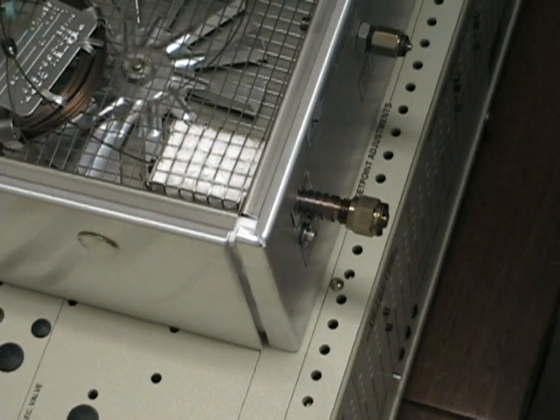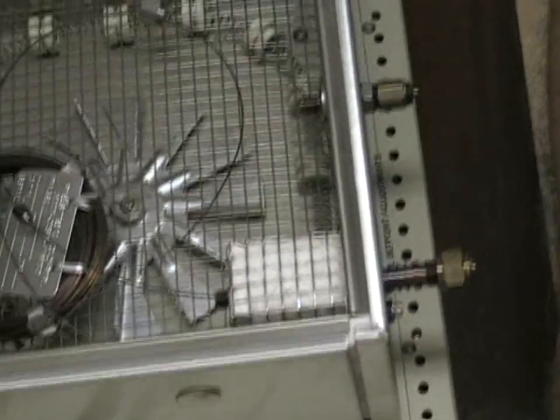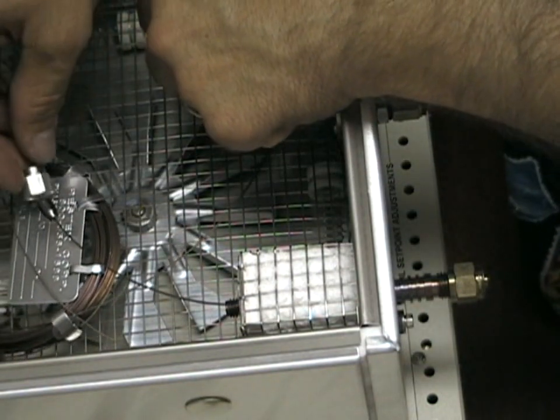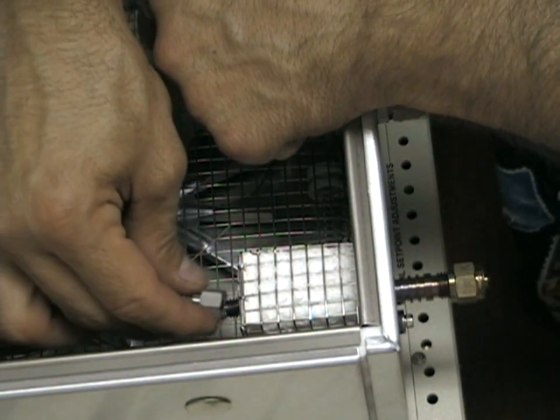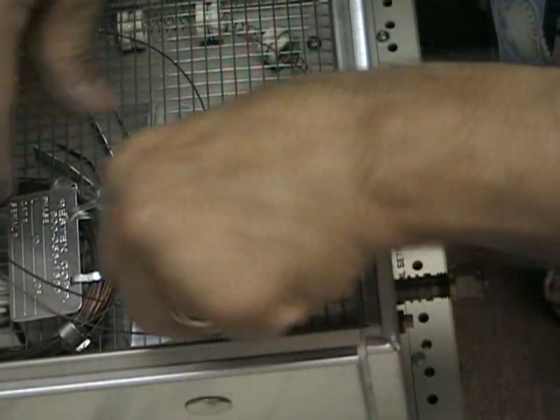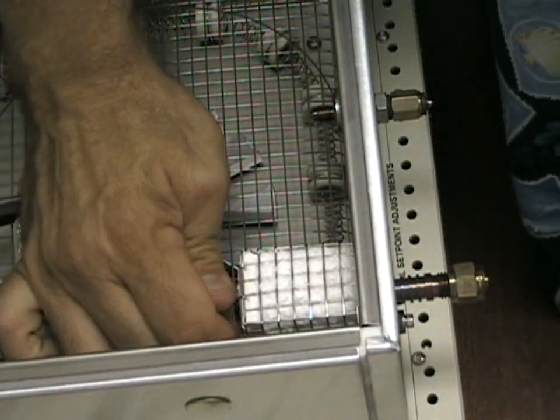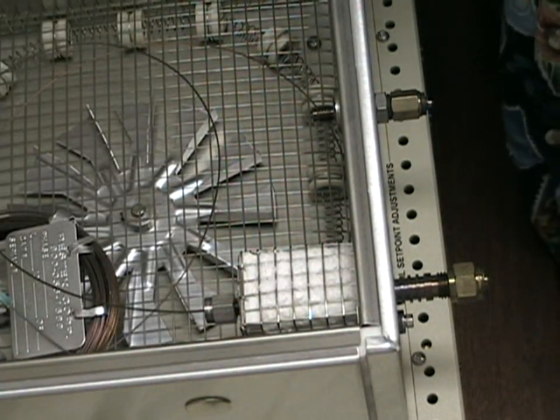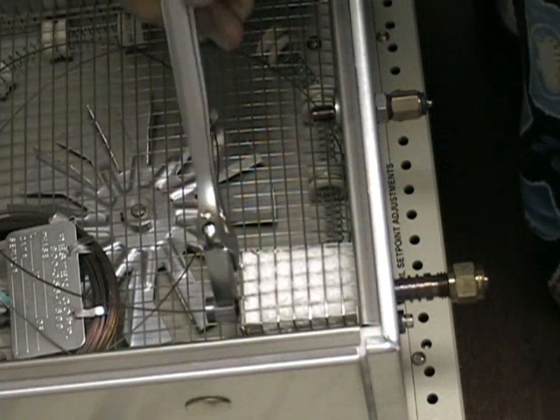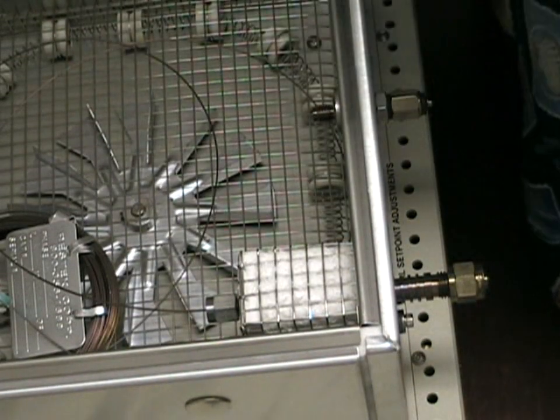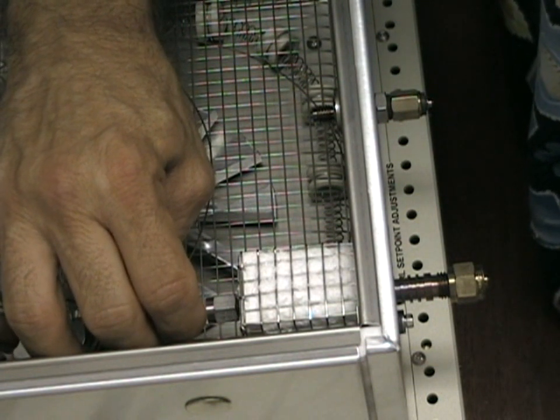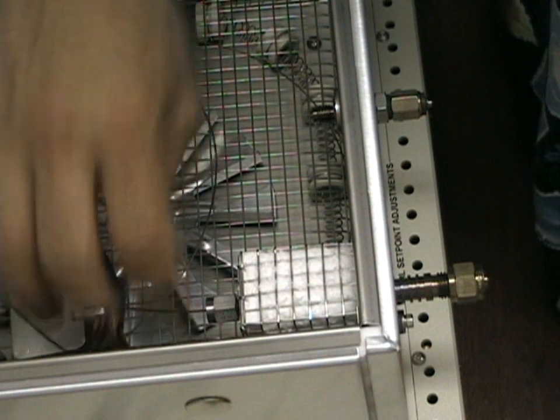And then from within the oven you want to push the nut with the graphite ferrule to the rear fitting of the injection port and tighten it finger tight. And then using an adjustable wrench, go three quarters of a turn past finger tight. Grab the end of the column and try to pull. If it doesn't move, the ferrule is tight enough to give you a good gas tight seal.